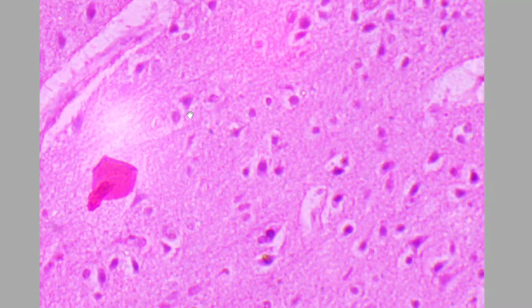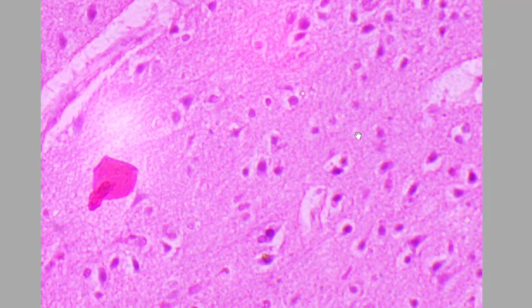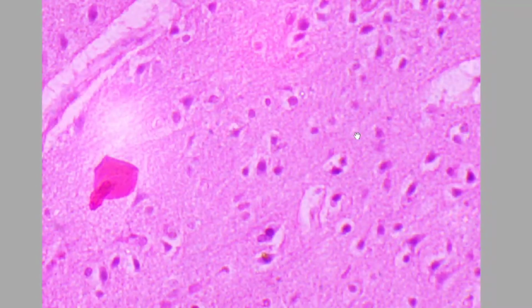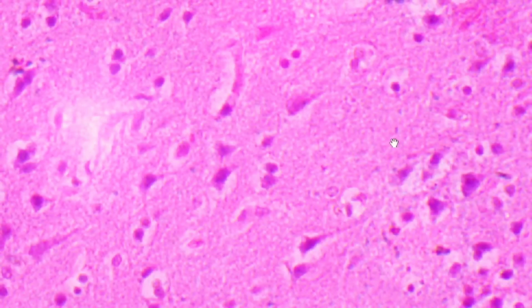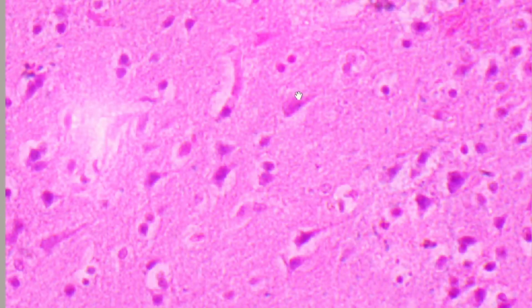My concern is that you should not be required to identify each and every cell, but if you are able to identify 2, 3, 4 such triangular bodies, you should make sure that you are dealing with tissue which is having the neurons, and these neurons are multipolar. Here also you can see that this is a triangular area, and at one end you can see that this is a process of the neuron. So this is a triangle shaped body. Here also you can see that it is showing this projection.